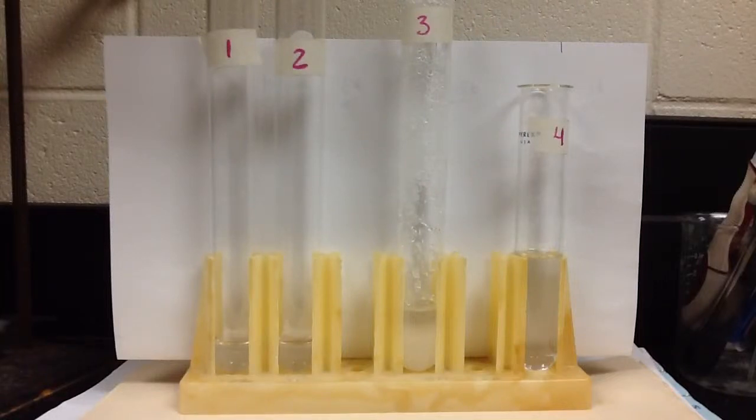Good morning, everybody. This is Mr. Mott. What we're going to do is go through the types of solutions lab, where we experimentally determine whether a solution is saturated, unsaturated, or supersaturated.